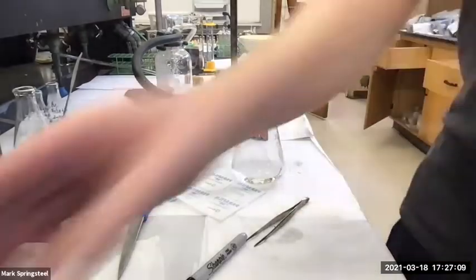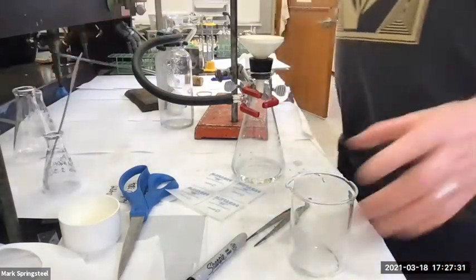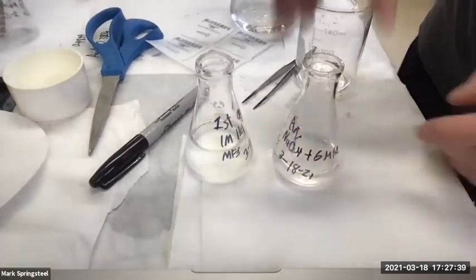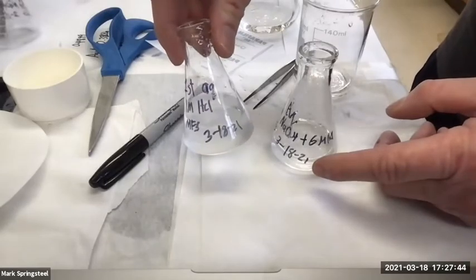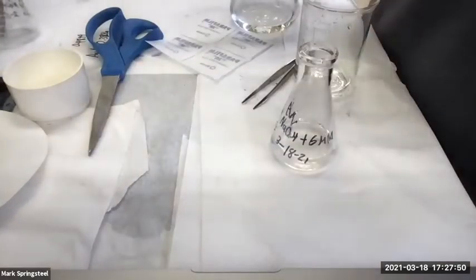Let me put this away first. Okay, so one thing I want to show you is our acidic layers. I got this layer that was a 6 molar HCl. It was a sodium hydroxide extraction that then we made acidic with 6 molar HCl. Got those two. Let me make sure. Yeah, plus 6 molar HCl. 1 molar HCl? No, this one I think is basic. First, yeah, I didn't write it down. We added 6 molar NaOH to this one.